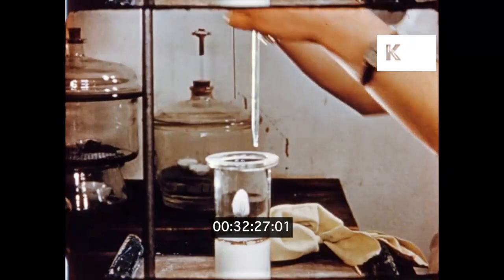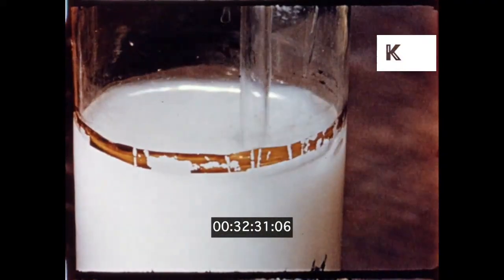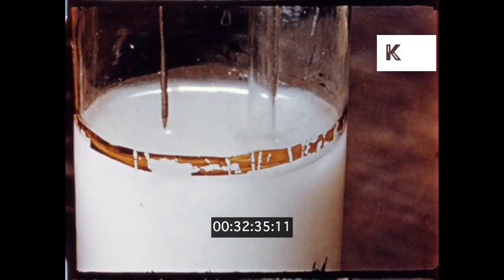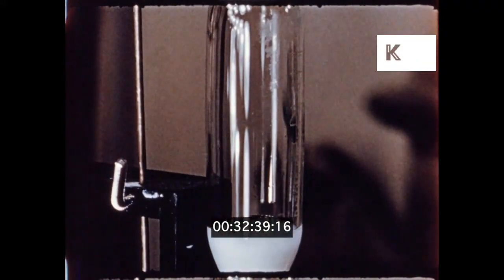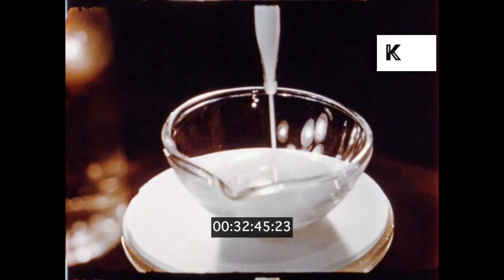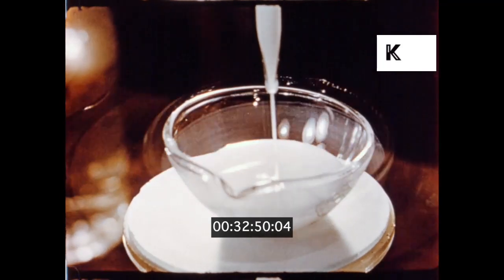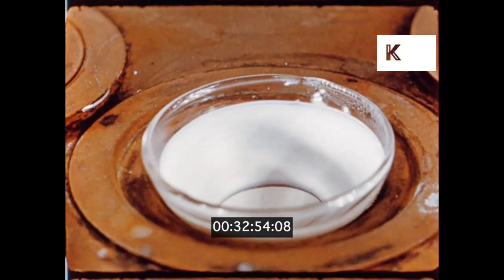Particle size is of the greatest importance in standardization. When the suspension has stood for a predetermined period, a precise amount of slip is drawn off from the correct level in the beaker. Large and therefore heavier particles drop first, followed by the finer ones. By drawing off a measured amount in a given time and evaporating the water, the clay can be weighed to establish the particle size of the slip.